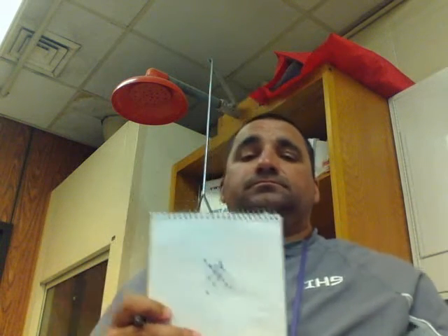Send someone up here. We're going to dissect the slide. Grab some scissors. I'm going to dissect the pea in here. It's right there underneath it. Need some scissors? Scissors to cut this stuff off. Alright. Is there anyone who doesn't know how to use these slides and slide covers?